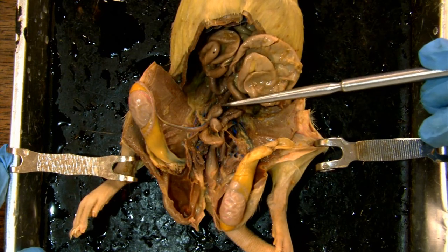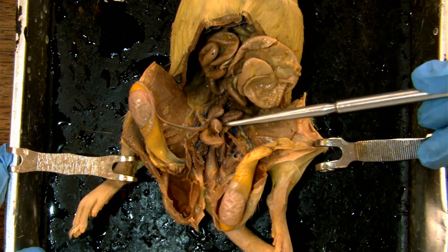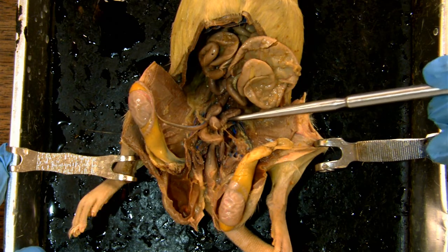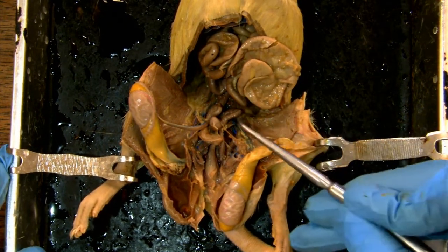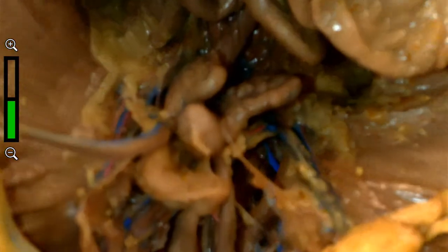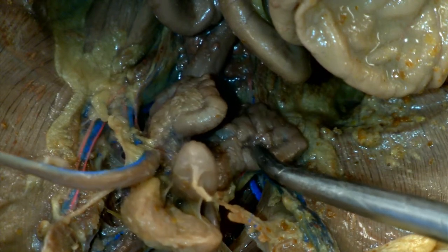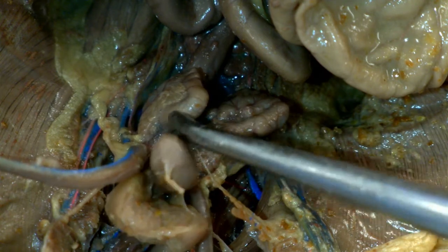There is this gland here — you can see there are like two wings that are connected down in here. Each one of these has two portions. The outer portion is called the vesicular gland. So this is the vesicular gland, and so is this one.